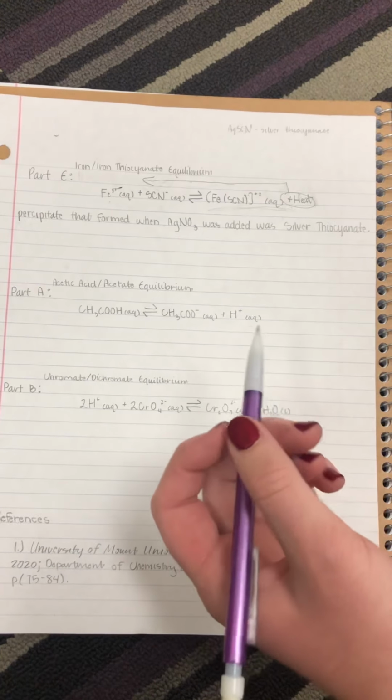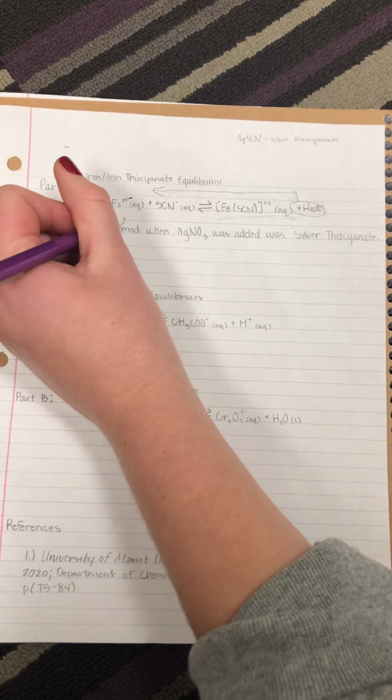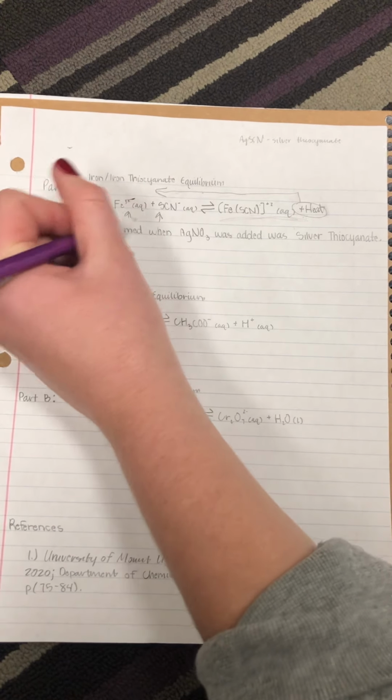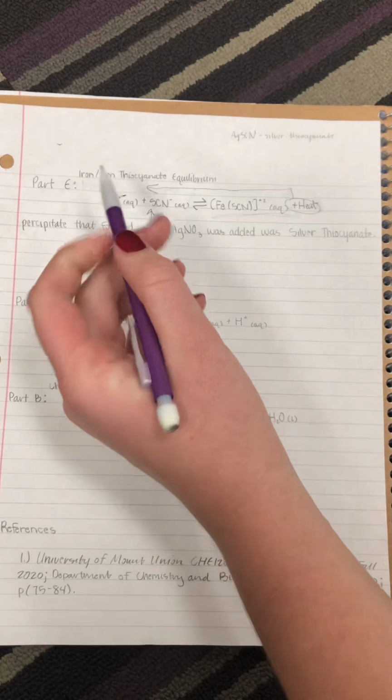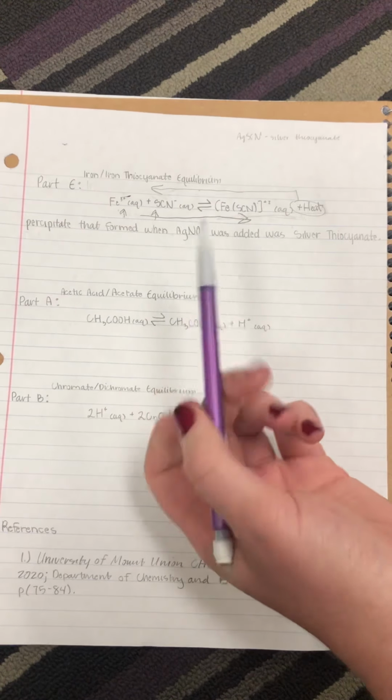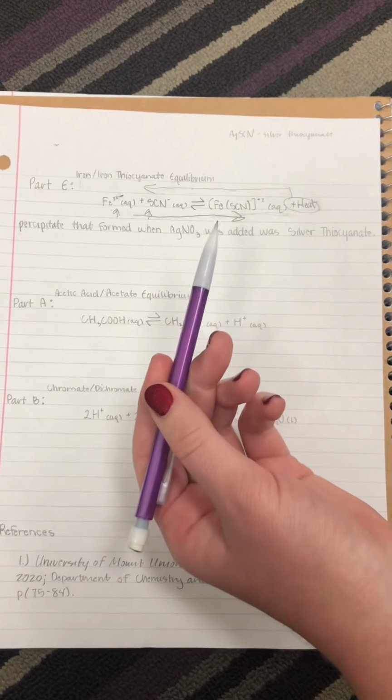The second stress added was double reactants. When added to the solution, the color turned to an even darker red. So double reactants right there. This is a result of the equilibrium shifting to the right to reestablish equilibrium between the products and the reactants after an abundance of reactants were added.